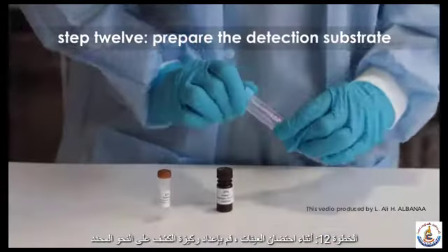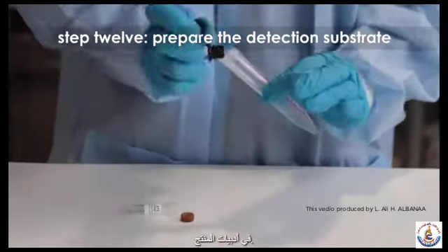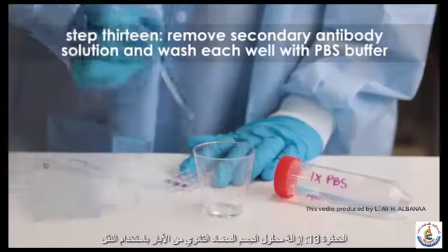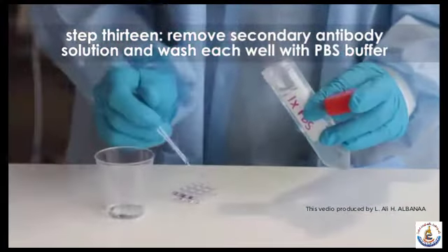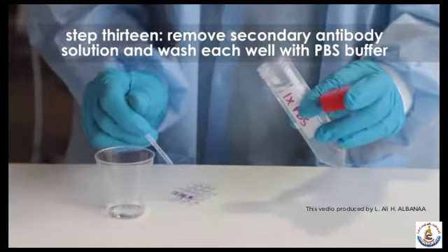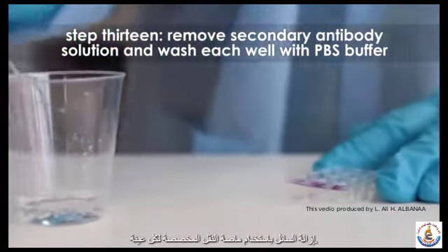Step 12. While the samples are incubating, prepare the detection substrate as specified in the product literature. Step 13. Remove the secondary antibody solution from the wells using the transfer pipette designated for each sample. Wash each well once with fresh PBS buffer. Remove the liquid using the transfer pipette designated for each sample.